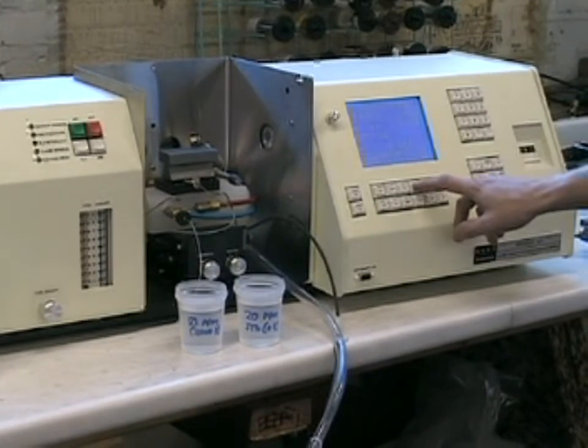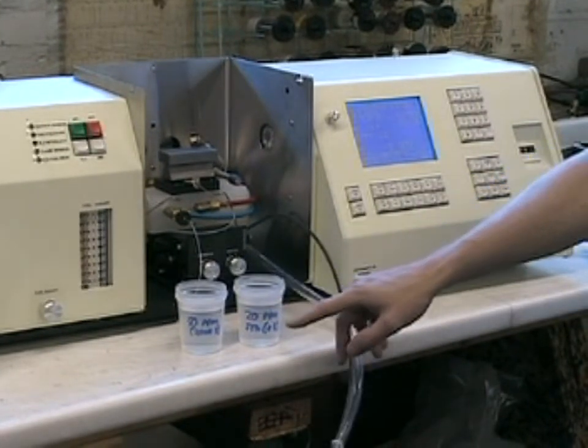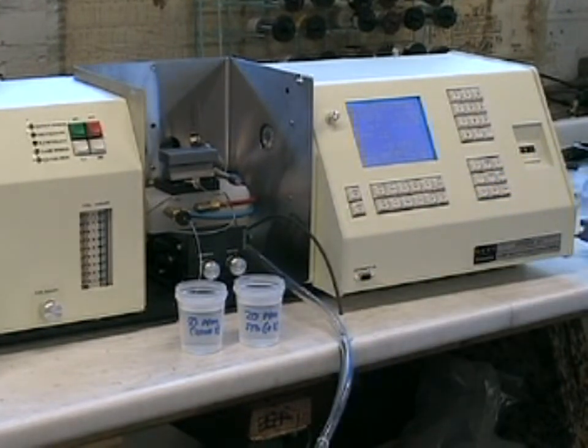Then, using the buffered solutions, we will want to make some optimizations of both the fuel flow and the burner position, which are more critical in nitrous oxide operation than in air acetylene operation.